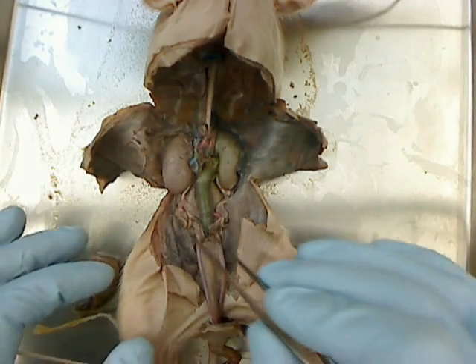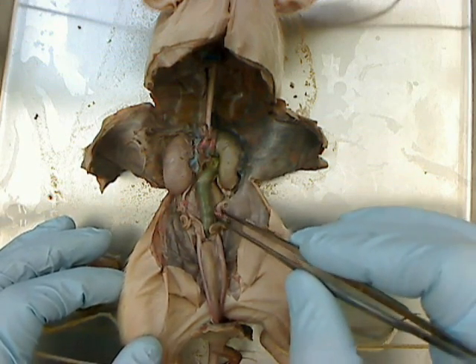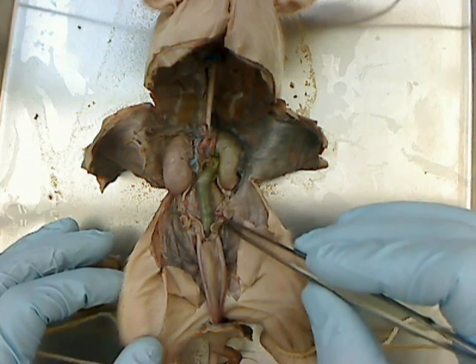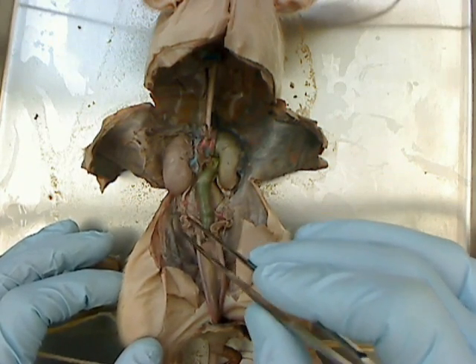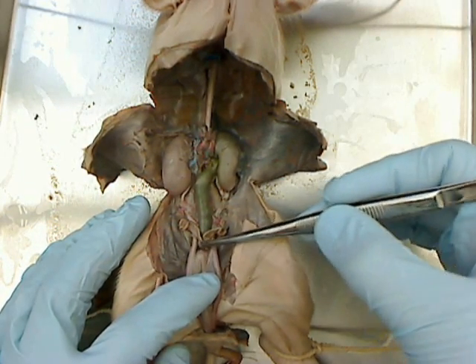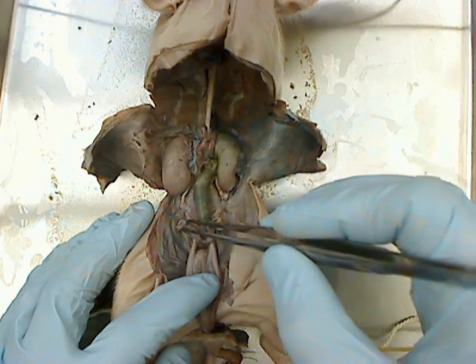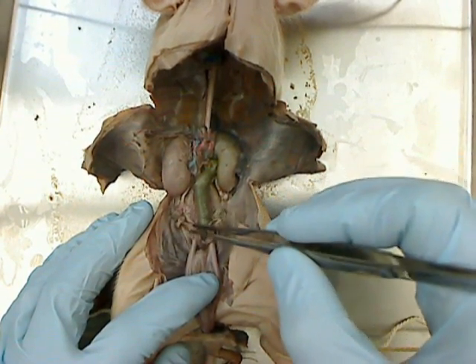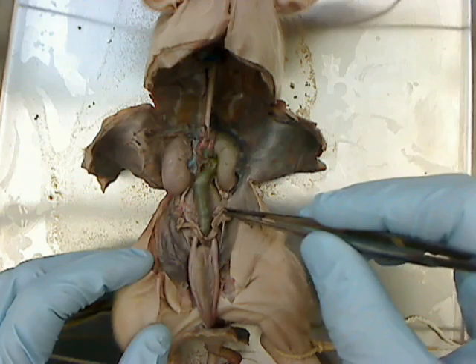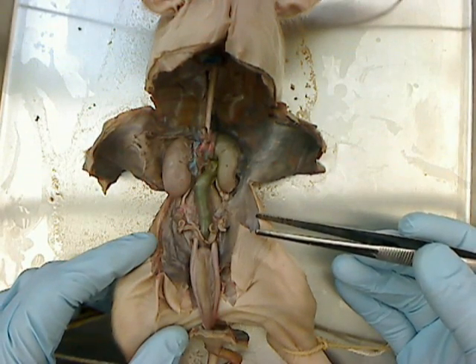For reproductive organs, this is the right ovary. And if I can get it up, that's the left ovary. This would be the left fallopian tube, and this would be the right fallopian tube. And in the center, we would call this the uterus. Fallopian tubes on the pig are actually very short — they have a long Y-shaped uterus because they have multiple offspring. So what I'm calling fallopian tube here is, in reality for the pig, part of the uterus. And that's it for the reproductive system and the renal system on the female pig.